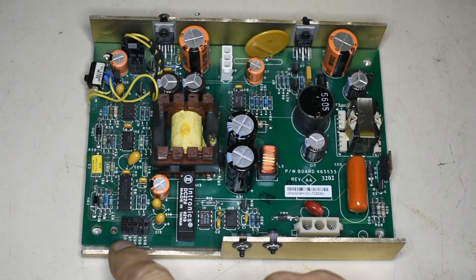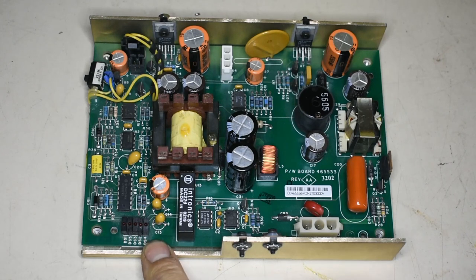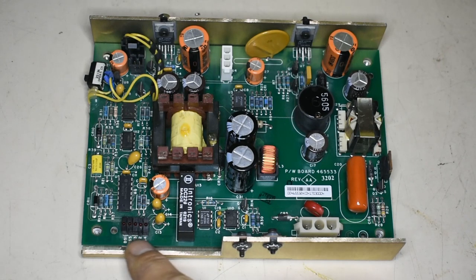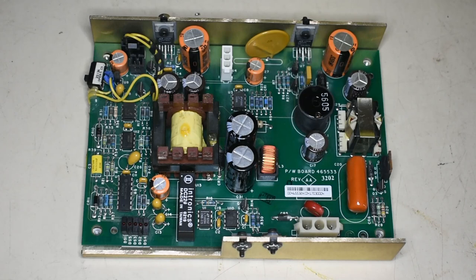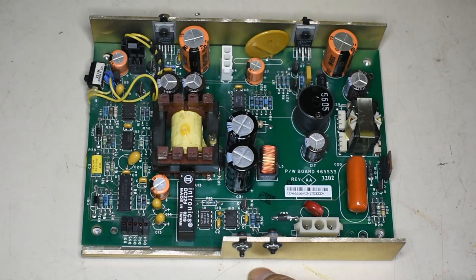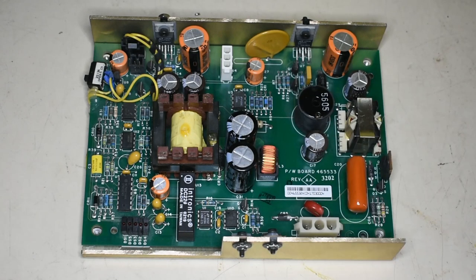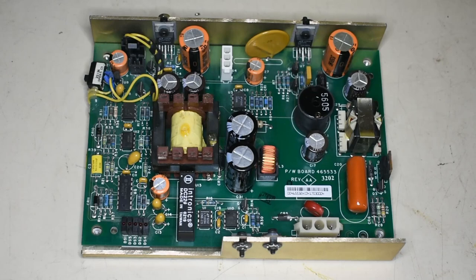What's interesting is this little set of LEDs along here. This is a kind of status bar telling you what the state of the lamp's run up is. So we can plug this in and have a little look at the process this goes through.